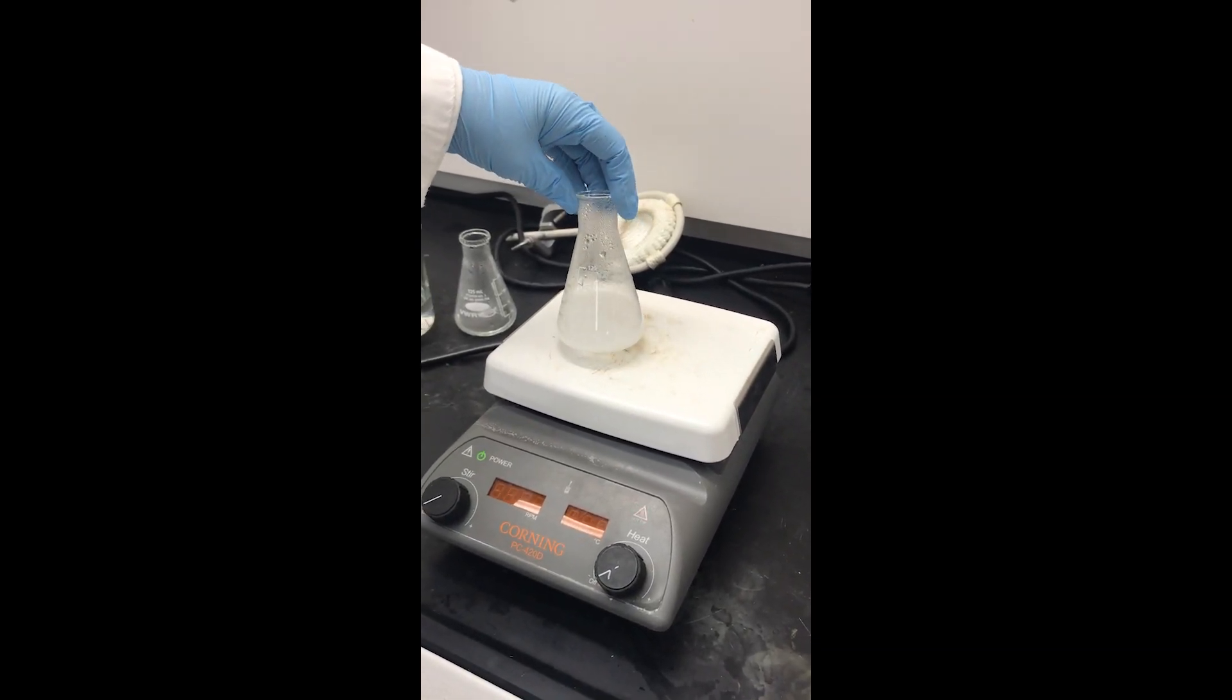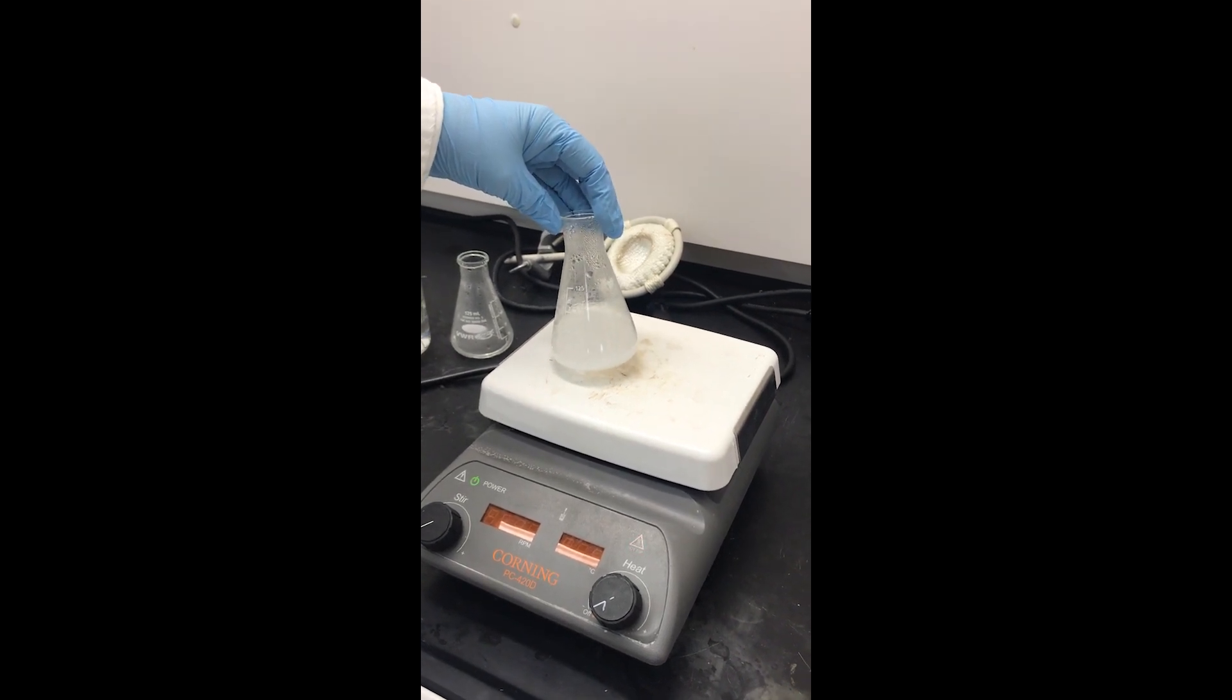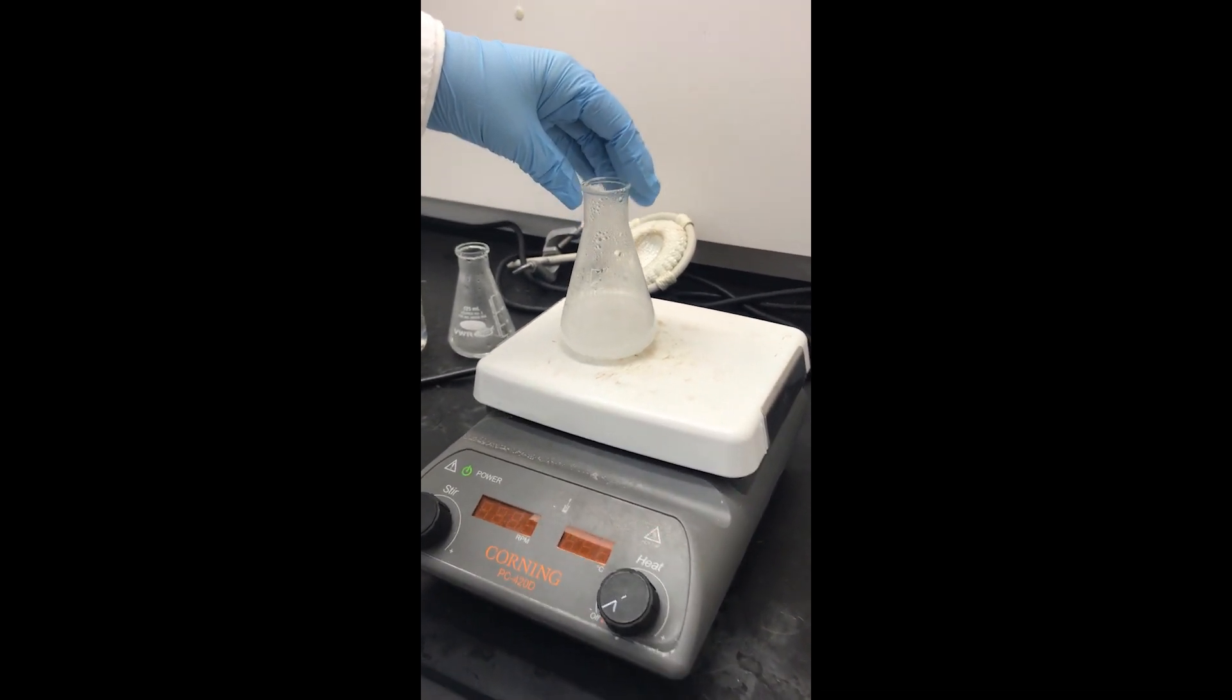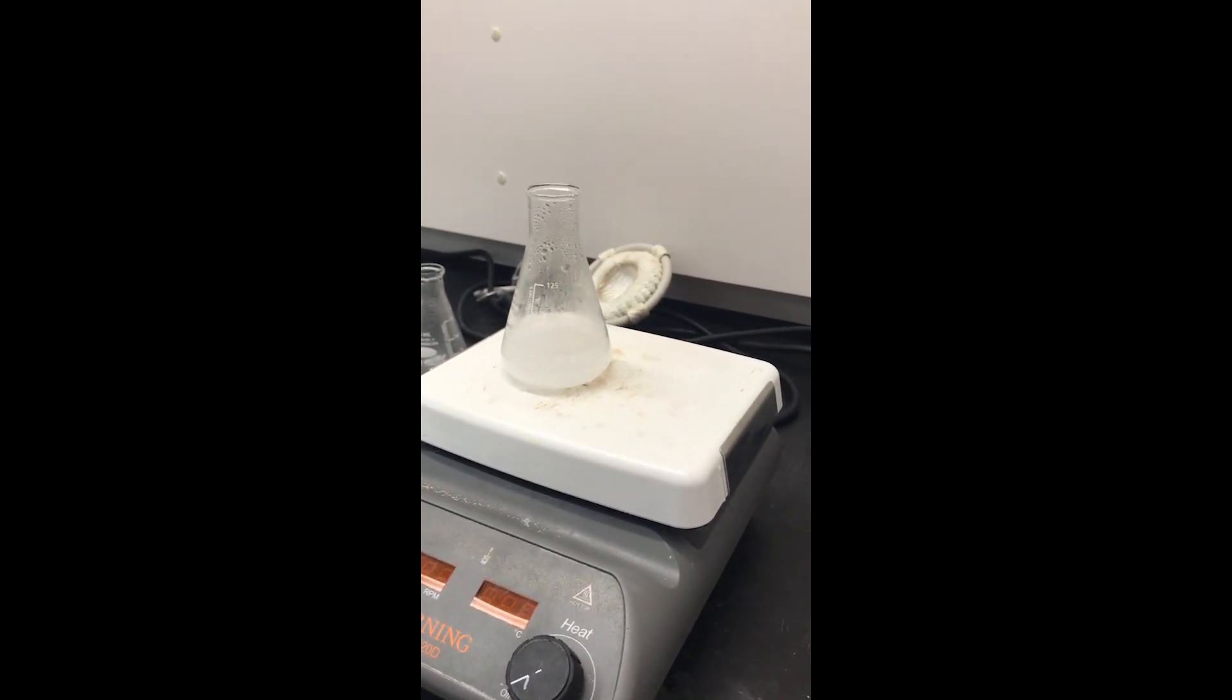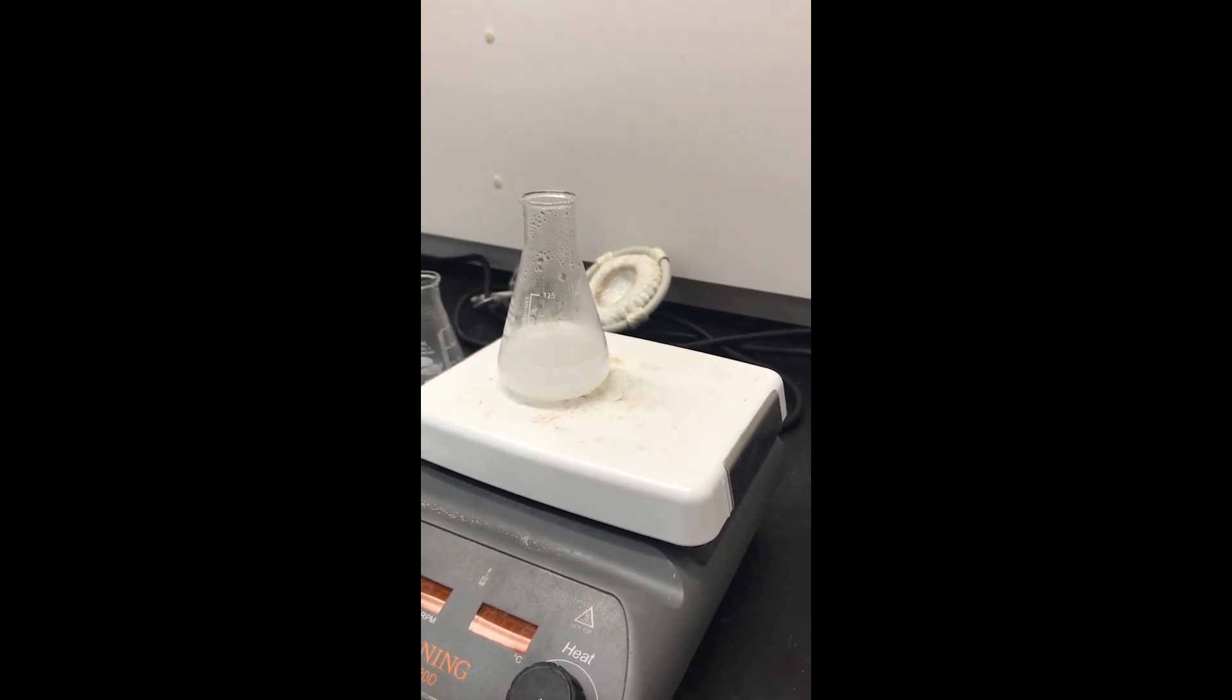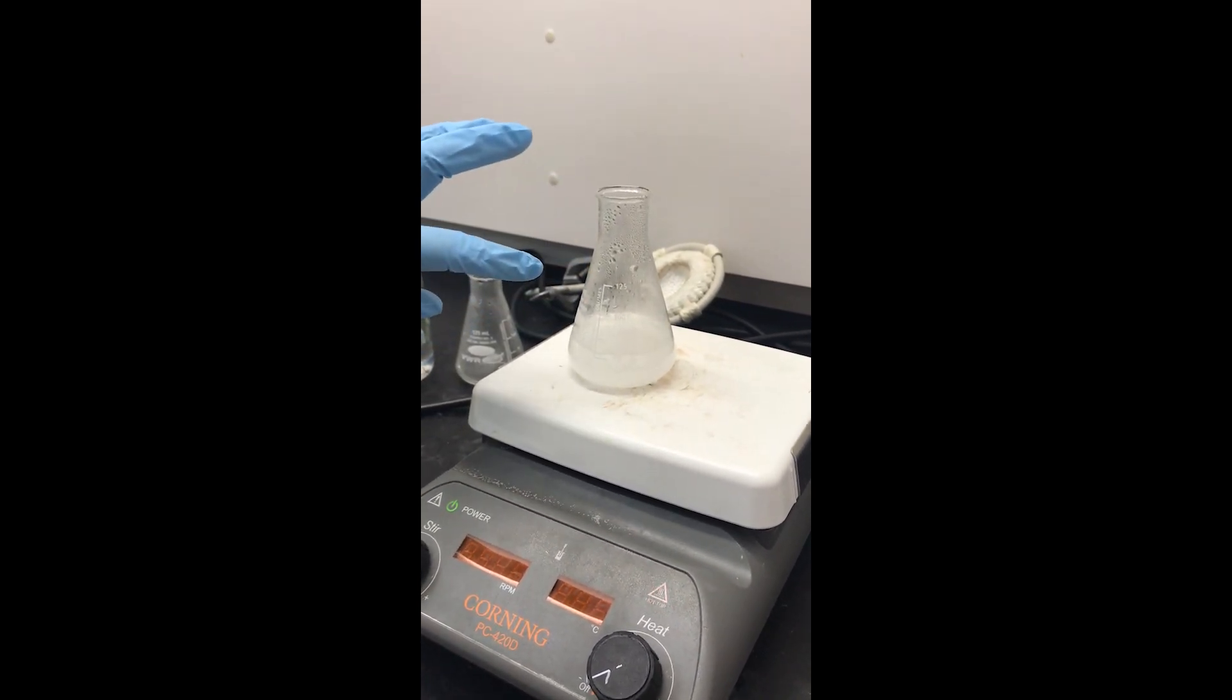We've waited a while and some crystals have started to form, which is what we want to see. The best thing to do is of course to leave it on the hot plate and allow it to cool as slowly as possible.